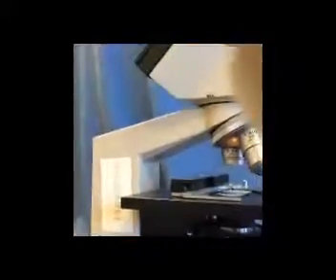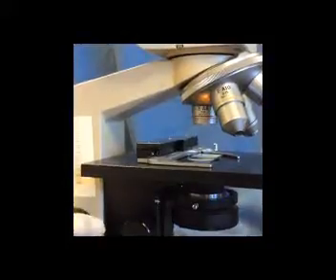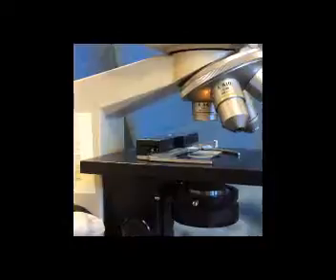So when we place our slide on the stage, we're going to look from the side. We're going to start with our scanning lens in place, and using coarse focus, we're going to raise the stage all the way up. And we're watching from the side to make sure by accident the stage and slide don't ram into the objective lens. It's only at this point that we're going to then look through our oculars, our ocular lenses, and then we're going to bring our microbe specimen into focus by lowering the stage, lowering the slide. And the reason we do this is for safety's sake. If we focus by lowering the stage, we'll never have an accident of ramming the stage and slide into the objective lens.